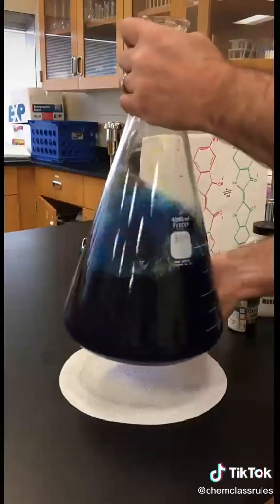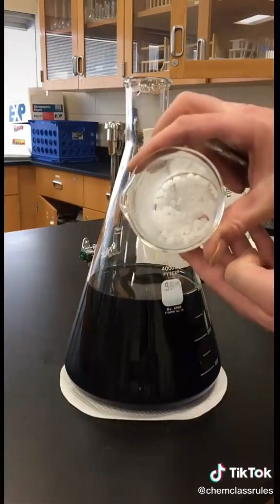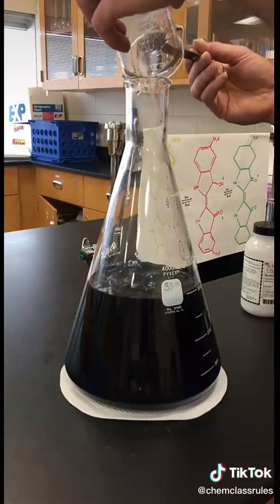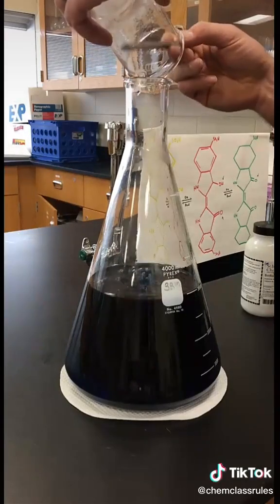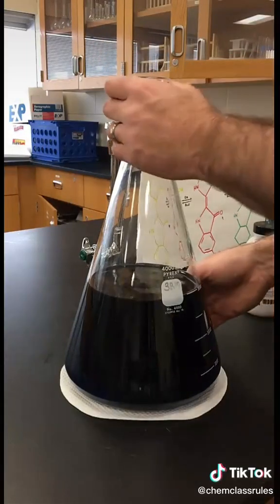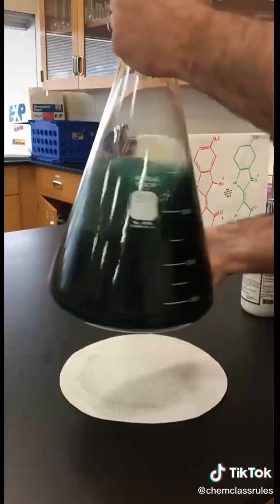Give that a little swirl to get it nice and mixed up. The next ingredient is sodium hydroxide. Sodium hydroxide is also called lye and it's in most drain cleaners. We'll give it another swirl here to get it nice and mixed, and it's also going to start to show us a little green color.